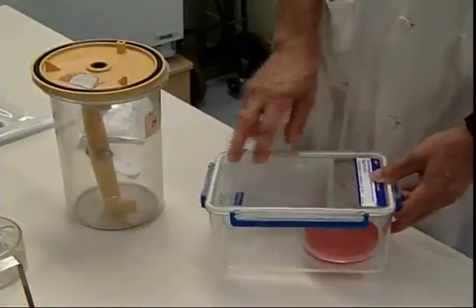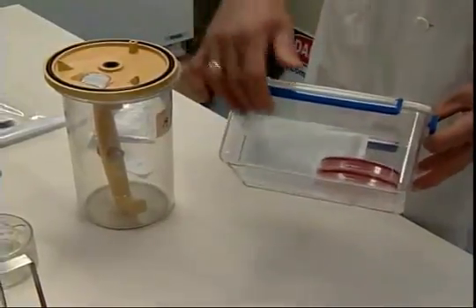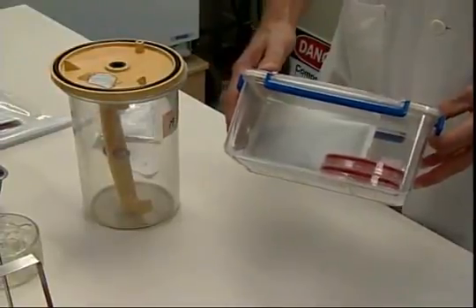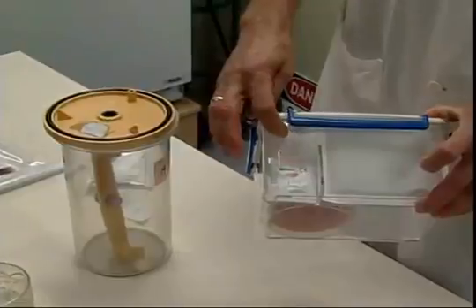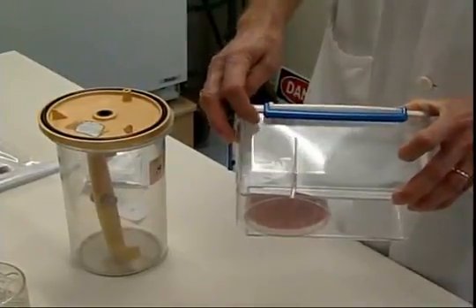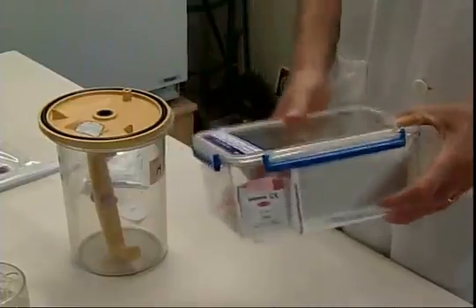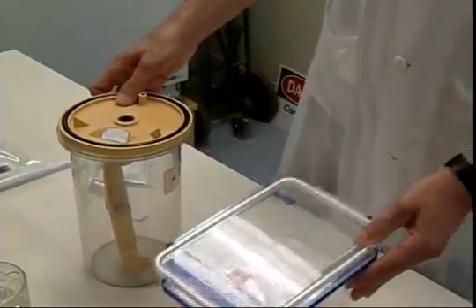So in the morning, there'll be a little bit of condensation on the top of the jar, but all the oxygen inside should be depleted so that anaerobes can grow. As you can see, that white indicator has turned pink, meaning it's been exposed to oxygen, but by tomorrow morning that indicator should be white, telling us the jar is working. These are incubated for 48 hours.